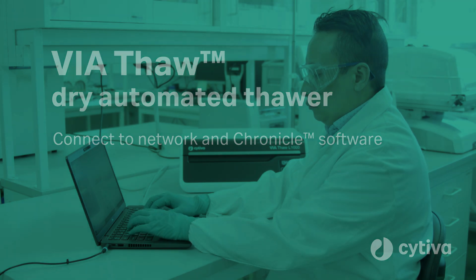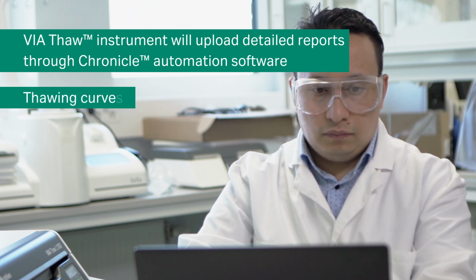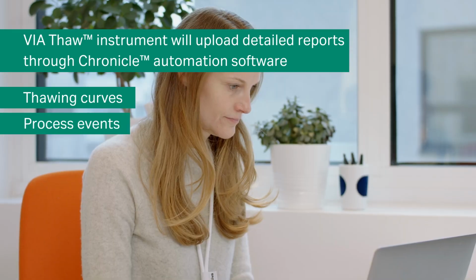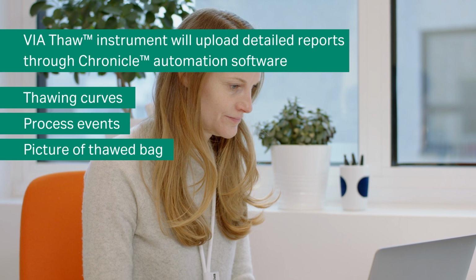When connected to Chronicle software, a Thaw instrument will automatically upload detailed thawing reports. These reports include information such as thawing curves, a list of process events, and, if applicable, a picture of the thawed bag at the end of the process.